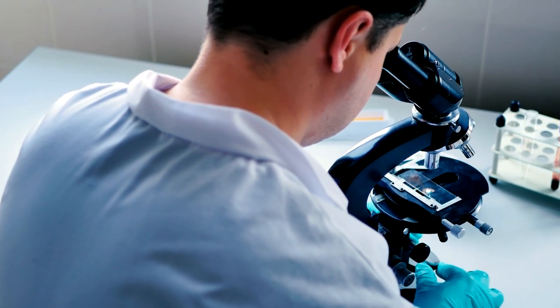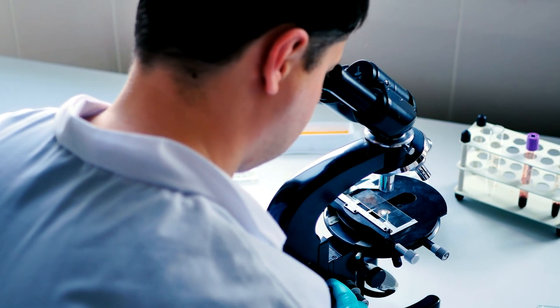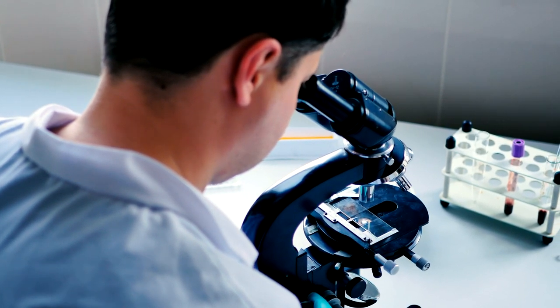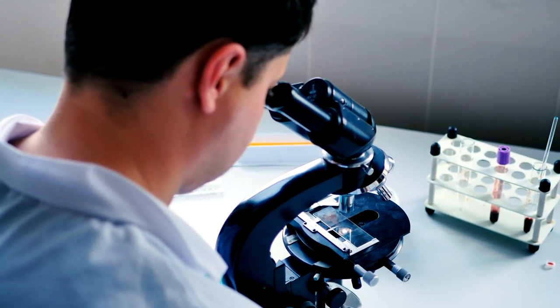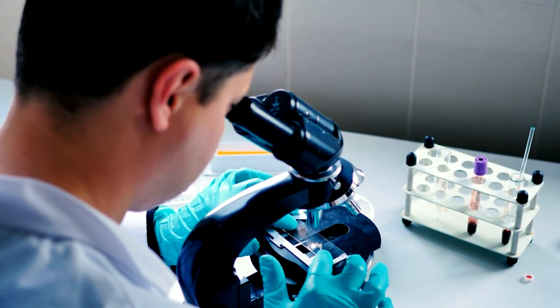Light microscopy has become very accessible to the amateur to do basic observations in biology. However, microscopes are not only a great tool for the amateur, it still is a highly important and indispensable research tool to study phenomena in living cells.